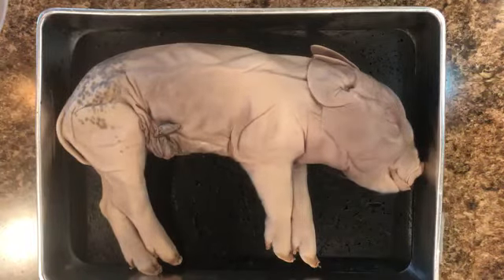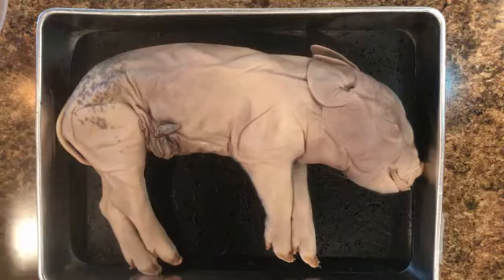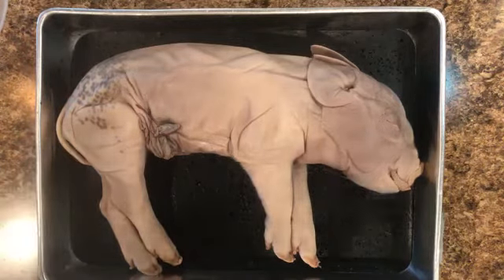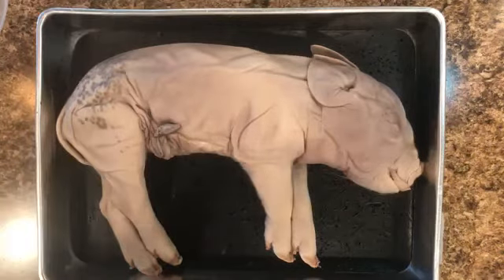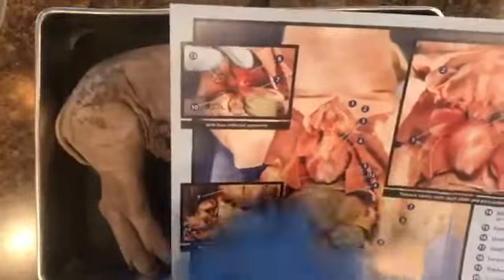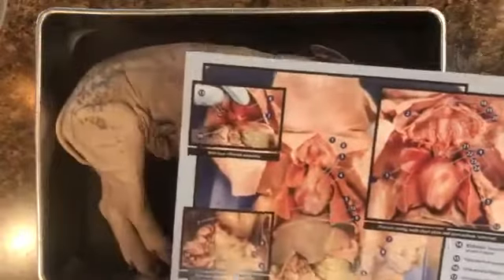So why do we dissect? First off, anyone who is interested in a medical career, in the medical field or some type of healthcare career, it's really hard to just look at diagrams and then know what things look like. For example, I could show you a fetal pig that's already been dissected, and here are some really good pictures.